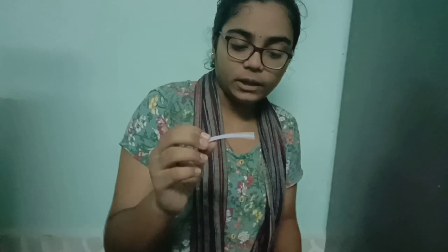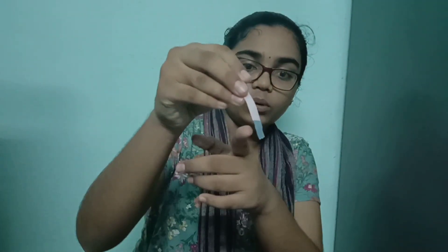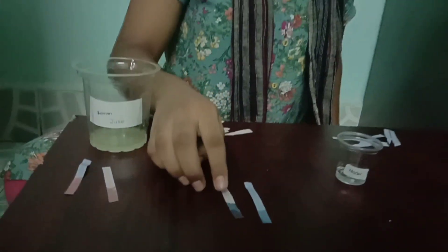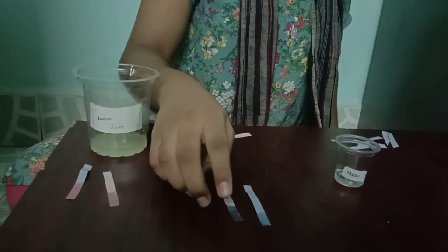Now next, NaOH — that is sodium hydroxide. First I am taking blue litmus paper and dipping it in. See, there is no change. Now I take one red litmus paper and dip it in NaOH. You can observe that red litmus turns to blue. So from this activity we can say that NaOH is a basic solution because it turns from red to blue.